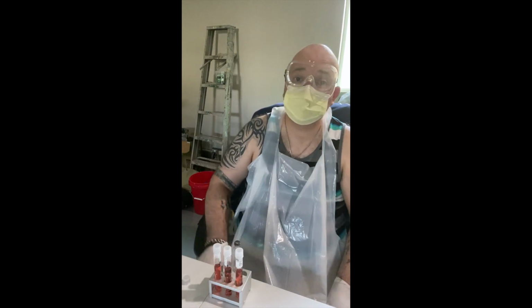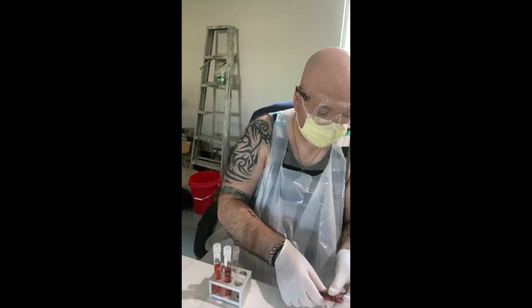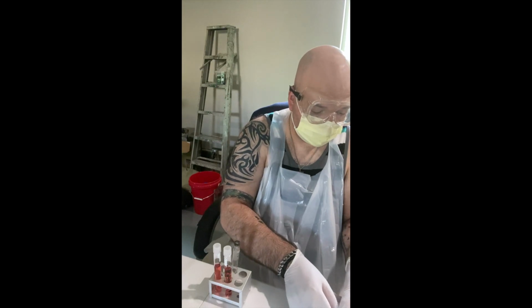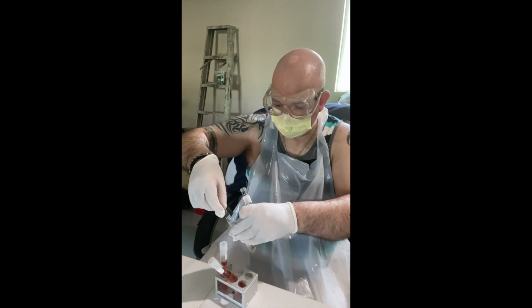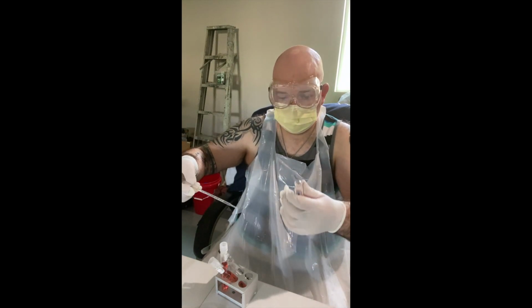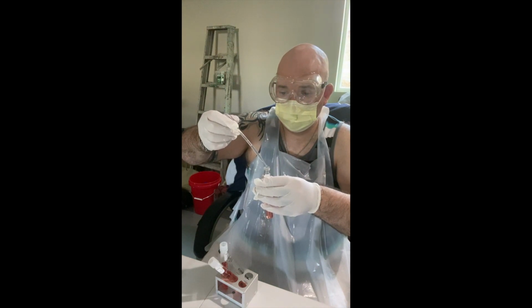And then 4 drops of the culture are going to go into each tube. So here's the first one. I'm going to flame it. Okay. With my pipette, I'm going to draw up some of the culture. And this is the one, this is S. epidermidis fructose, 4 drops. 1, 2, 3, and 4.